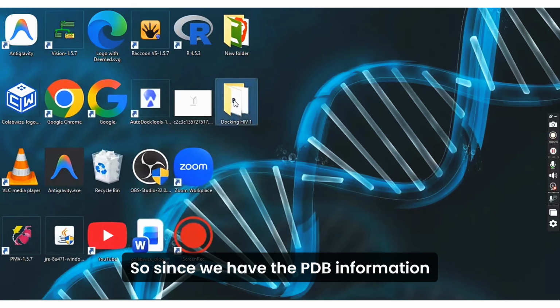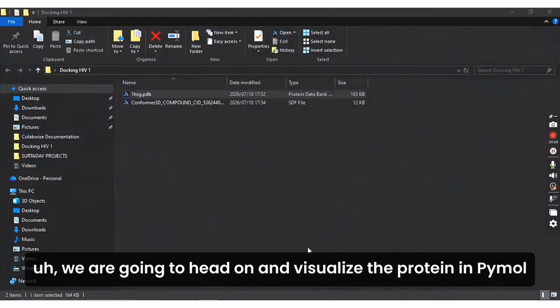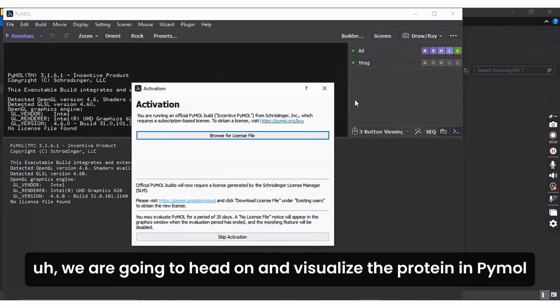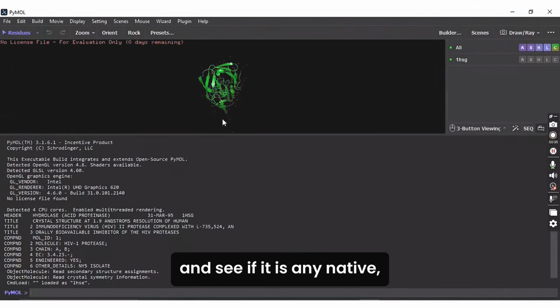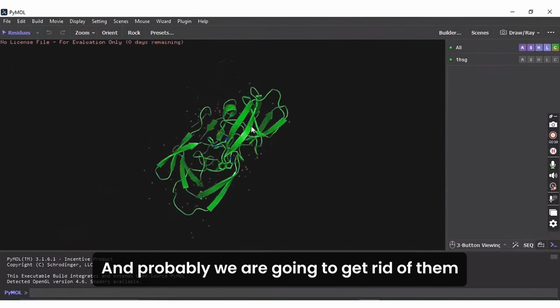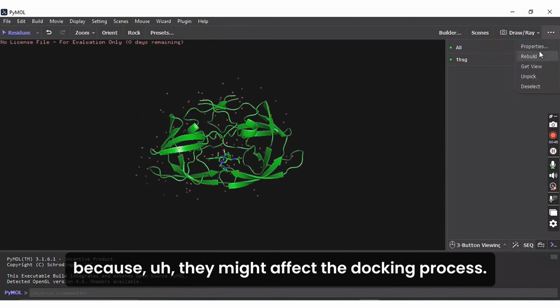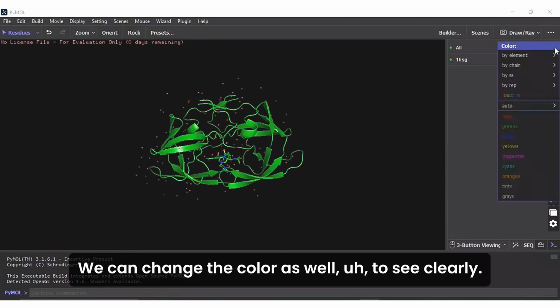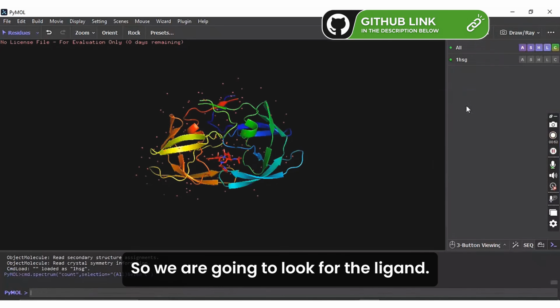Since we have the PDB information that we downloaded before, we are going to visualize the protein in PyMOL and see if it has any native ligands already there, and probably get rid of them because they might affect the docking process. We can change the color as well to see clearly. So we are going to look for the ligand.